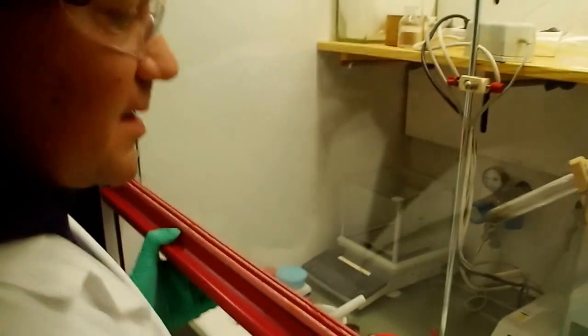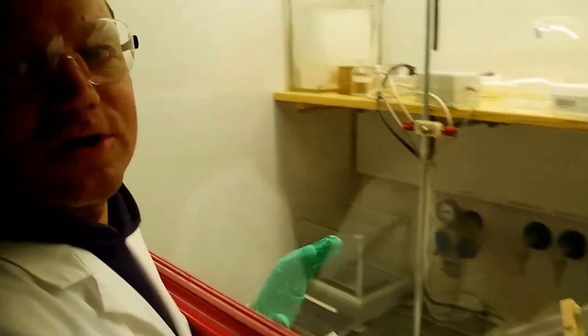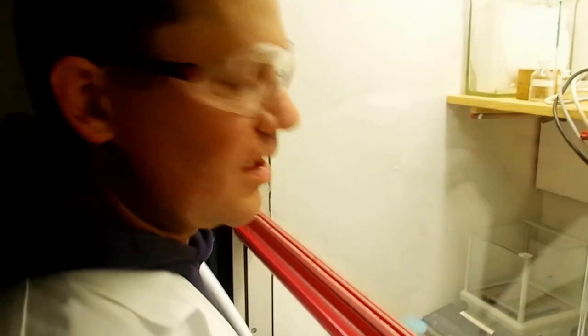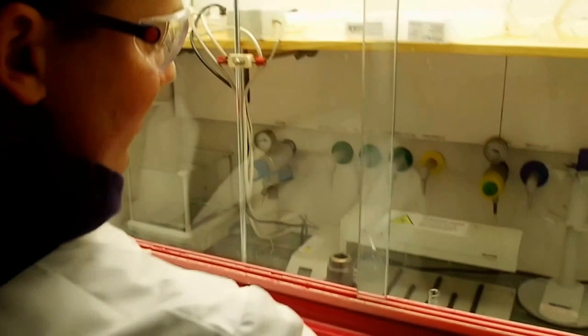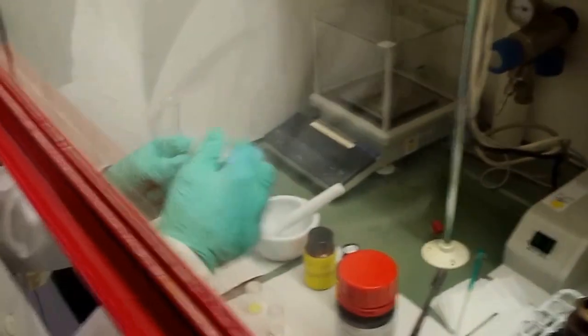So that means we now must use the temperature sensor, and we know from our experiments that we should not go above 200 degrees, because this is a pretty embarrassing side reaction arising from the instability of the cadmium precursor, the cadmium carboxylate, in alcohol. Okay guys, so that can happen if you cook too, right? So let's quickly restart the experiment, but this time we must control the temperature.